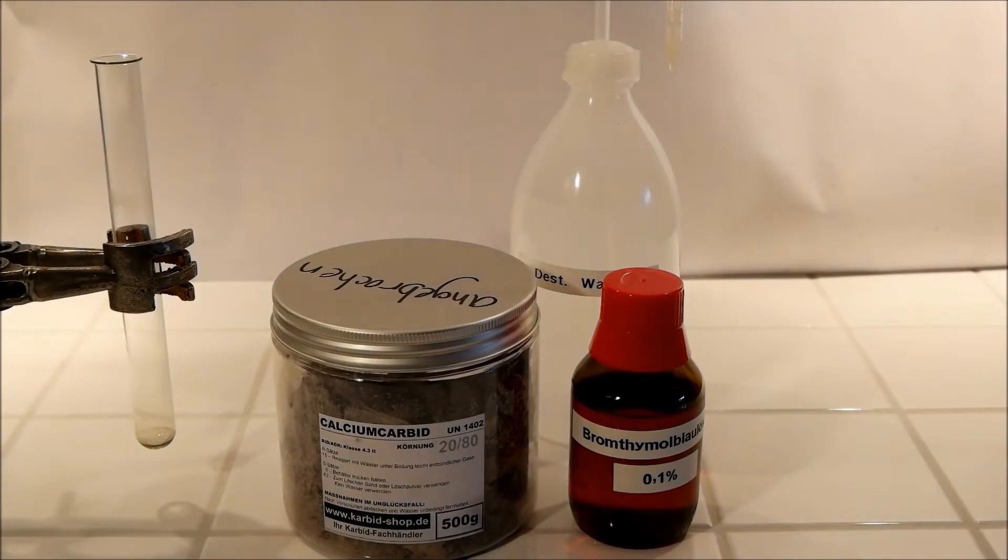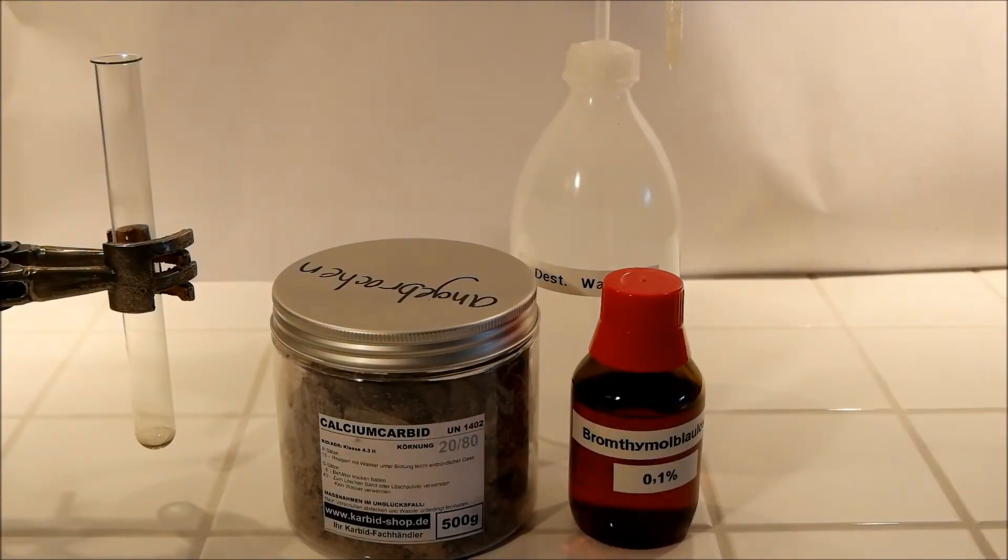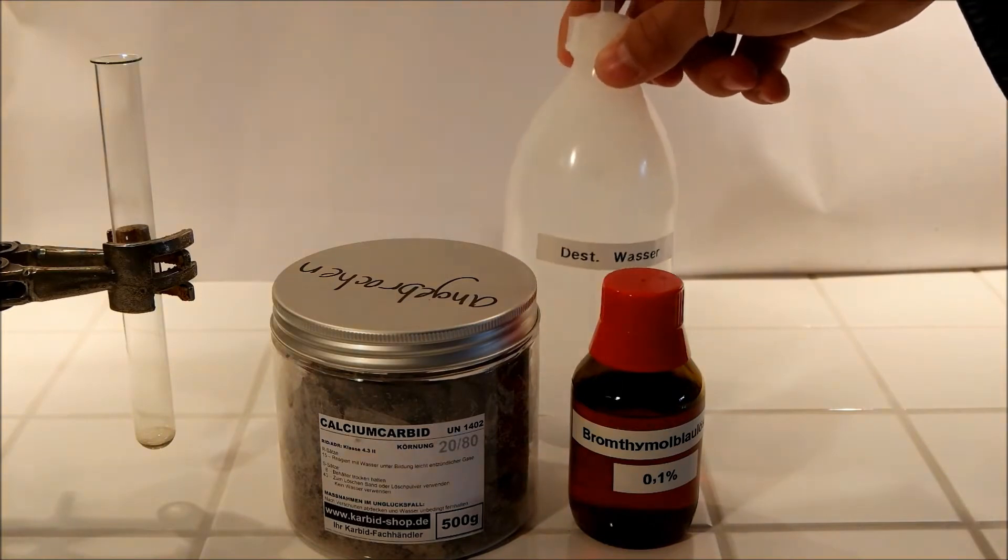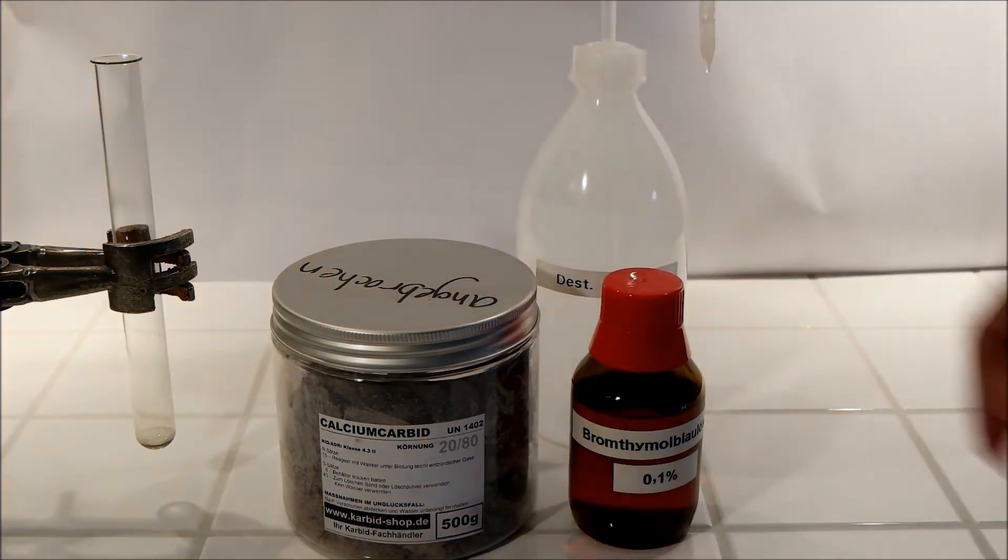Calcium Carbide. Today I'll show you a few interesting things about calcium carbide. If you mix it together with water you get a gas which is Ethine, and this gas is C2H2 and it's very flammable and I think we're going to try that.